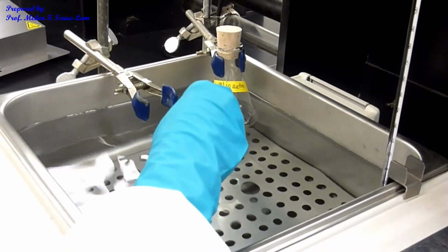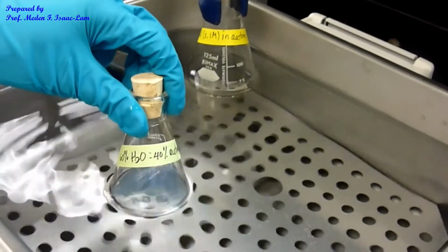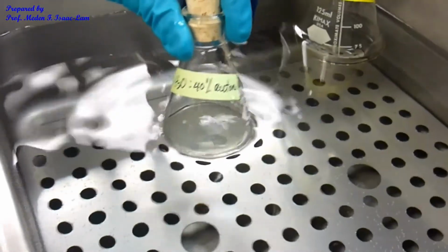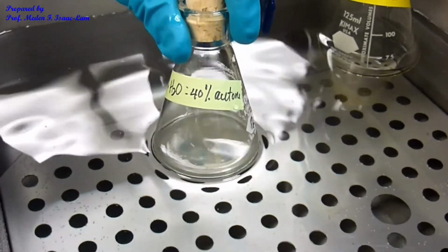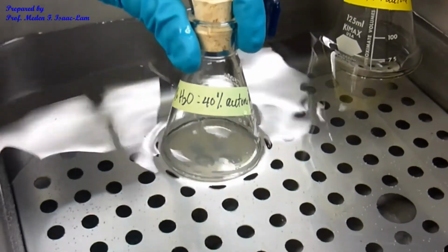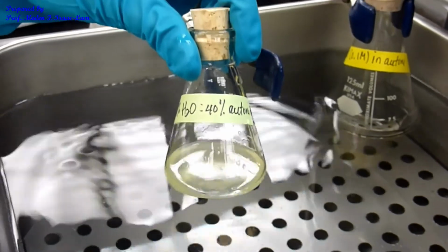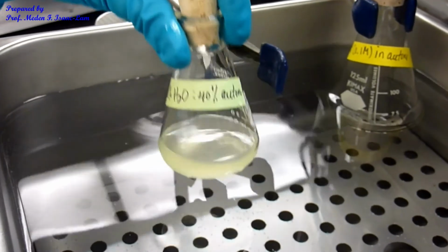So I'm going to swirl it until I see a change in color, which is greenish. So that changed in color already. That's like 52 seconds. So that was fast. Then it will continue until it's like changed into yellowish. Okay, so it changed color about 52 seconds. So that's the end point of it.